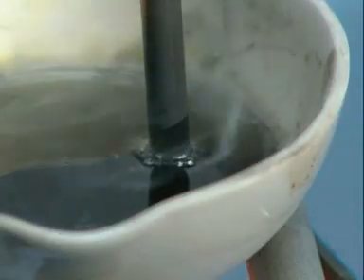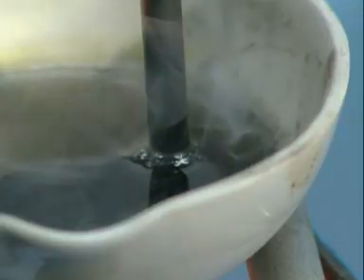This time bubbles of a very pale gas appear at the positive electrode. It turns damp blue litmus paper red and bleaches it lighter. So what gas is it likely to be?